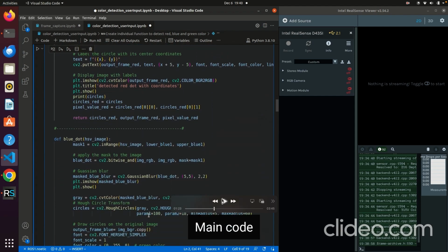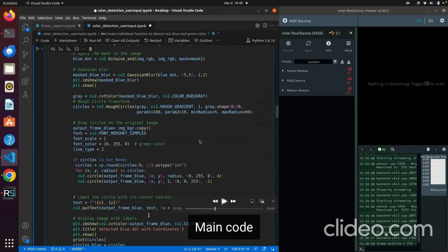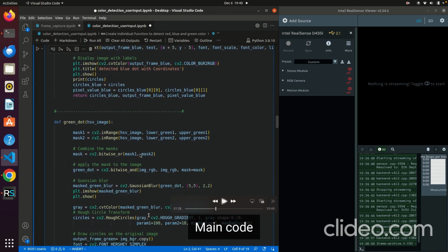And it's the same idea for the blue function, but the difference is I only gave it a lower and an upper, just one range, and I just apply the mask. Instead of combining two different masks, I just give it one mask. The same idea, you give it the Gaussian blur, and then you draw the circles that I found. And the same idea for the green dot. In this case, I gave it two different masks, and you do the bitwise operation to combine them, and you apply the mask.